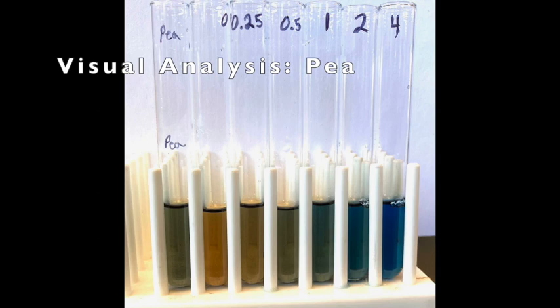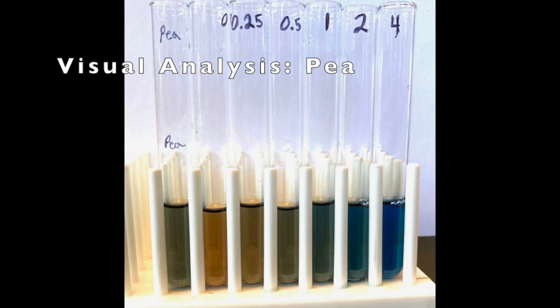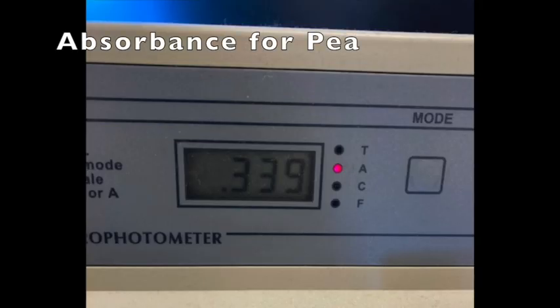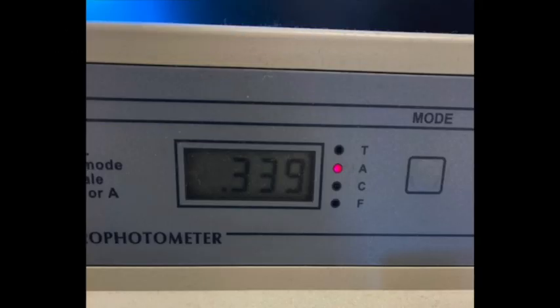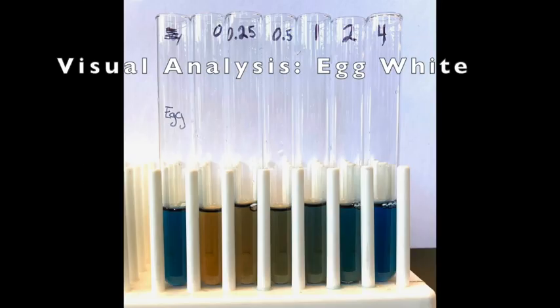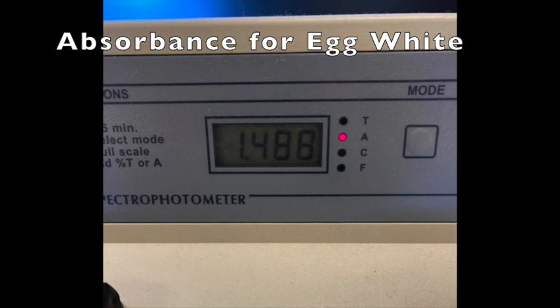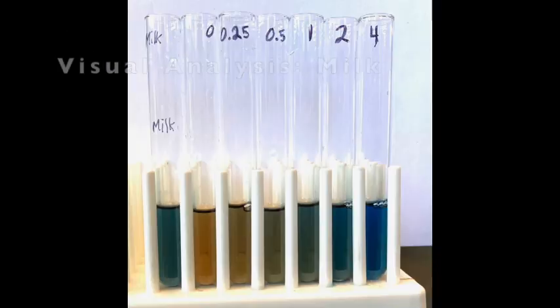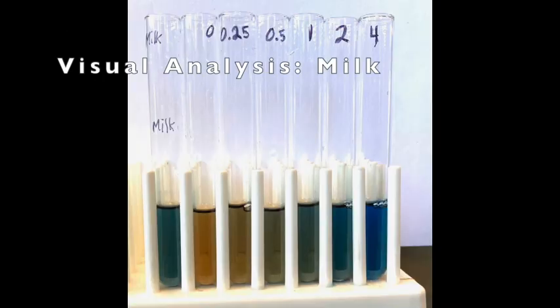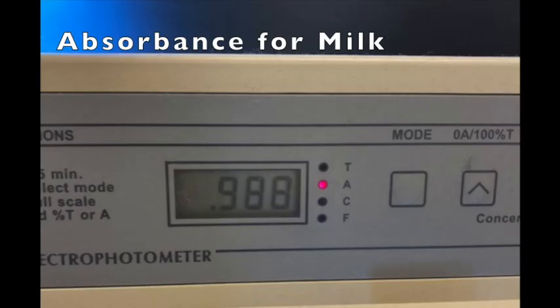Your next source will be pea, so write that on the next line of your data table. Complete a visual analysis comparing this pea tube to the known standards to determine a visual concentration. Then record the absorbance for pea, which is 0.339 absorbance units. The next protein source is egg white powder — compare the egg tube to the known standards for your visual analysis. The absorbance for egg whites is 1.488. The last protein source is powdered milk — compare the milk tube to the known standards, then record the absorbance for milk, which is 0.988.